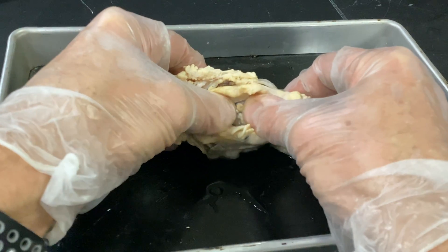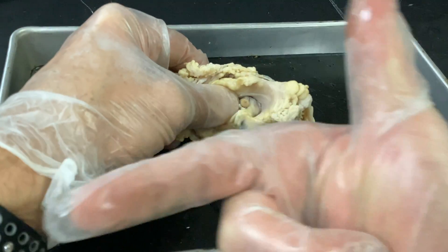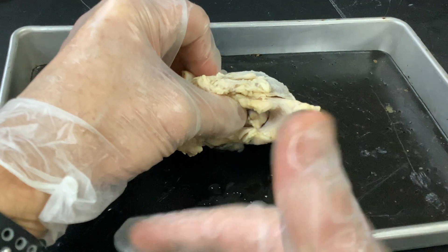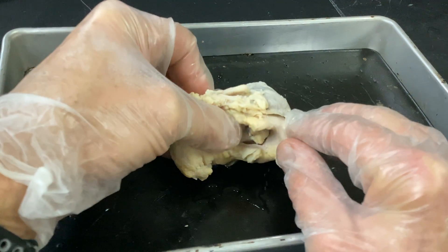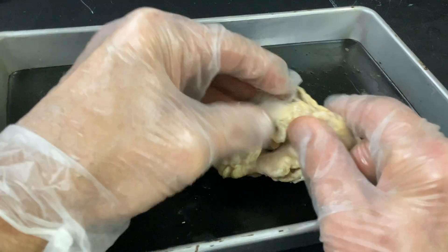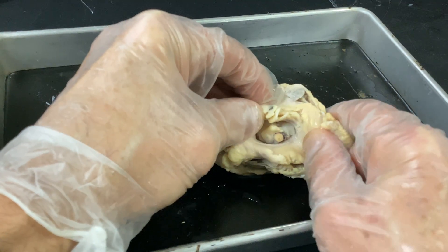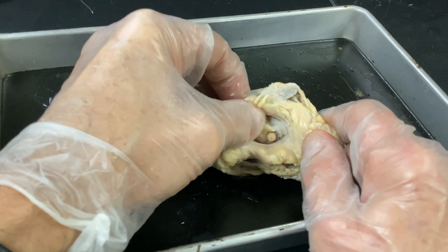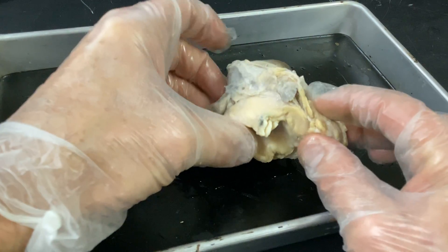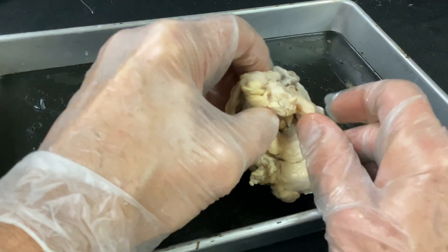Cranial nerve 2 should come in at an angle medially. I don't know if this is the right eye — this would be superior, this would be inferior. If it was a left eye, contingent upon how the cranial nerve is coming out, I wouldn't know. But I'm going to go in and cut all this muscle material away.